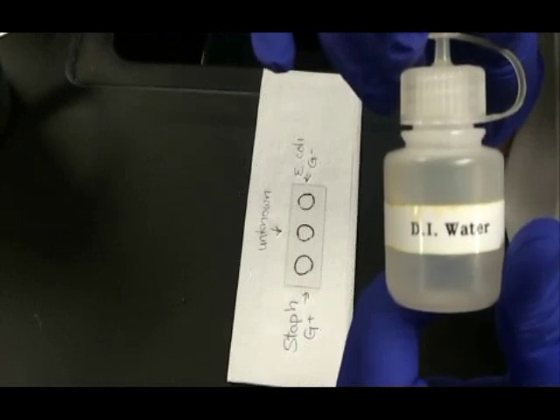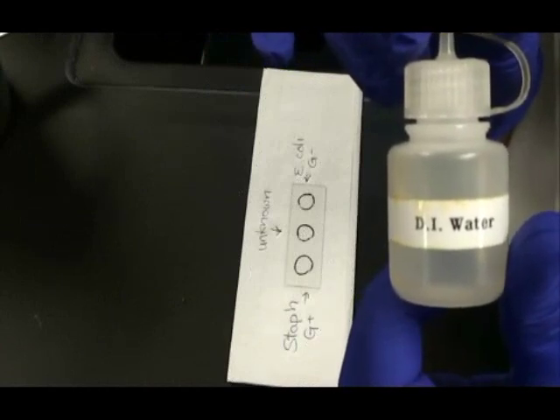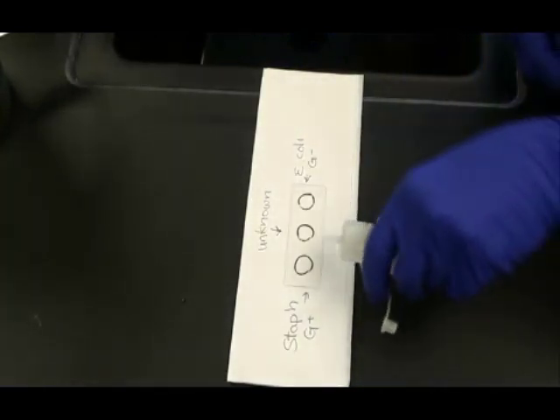I'm going to place a small drop of water inside each of those circles and that's what I will be mixing my bacterial samples into.